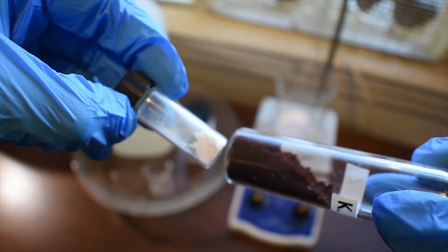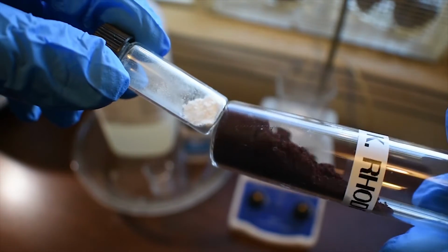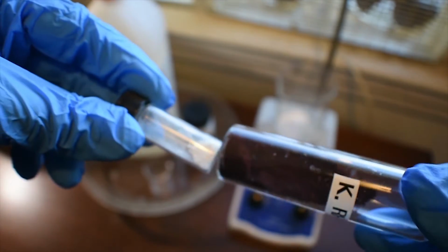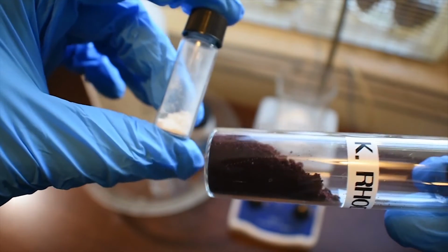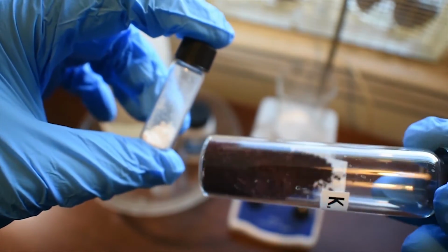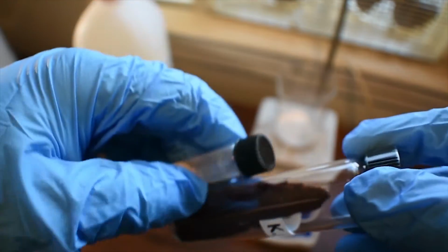Quite a big difference there. It's almost like a dark maroon, a very dark brown red, and it's just the potassium salt of this rhodizonic acid, and you can see it's such a big color change. It works sort of similar to how violuric acid works, if you've ever seen that, but it's a completely colorless acid, but its salts are extremely vibrantly colored. So with that being said, let's get on to the synthesis.